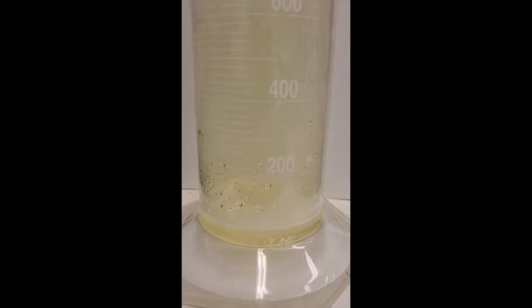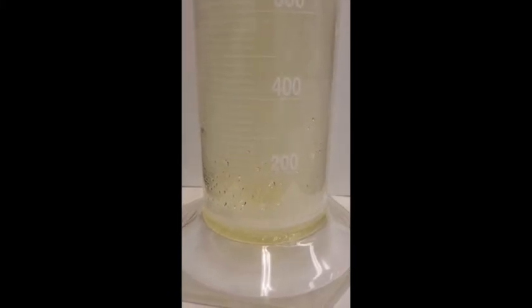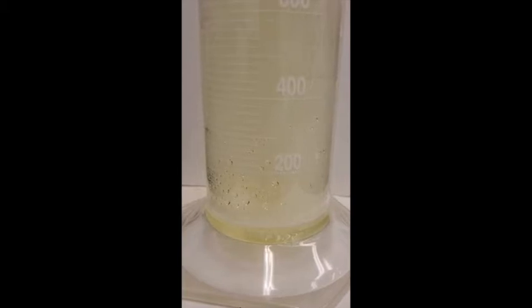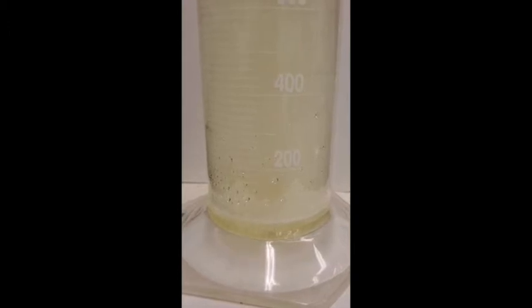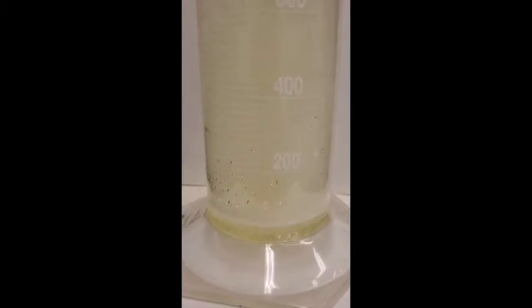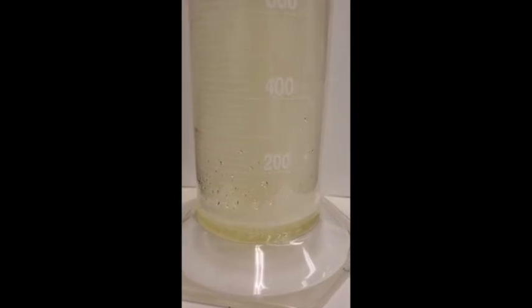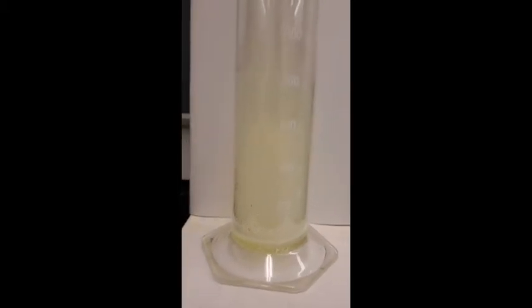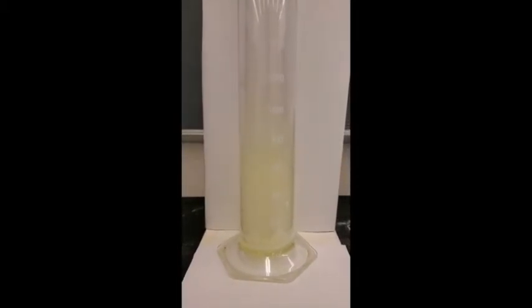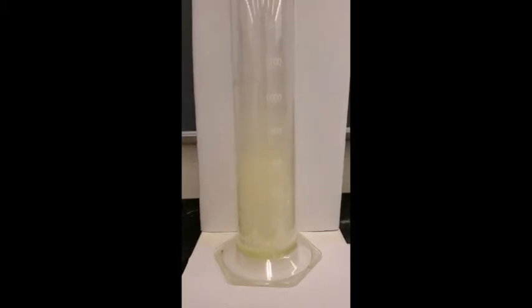Can you see white smoke being produced? Some of the hydrogen is exploding with the chlorine. Isn't that something? Can you see the white smoke, everybody? That's sodium chloride smoke. We've seen sodium chloride made from the direct combination of the elements. And that should take care of this part.